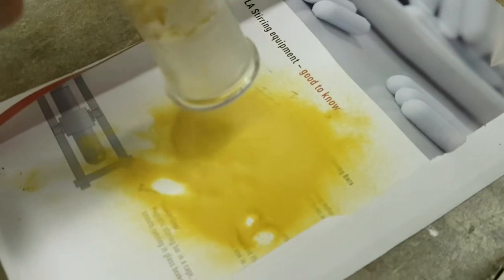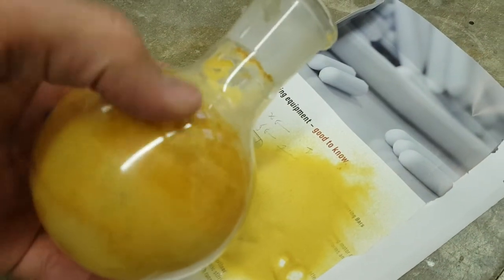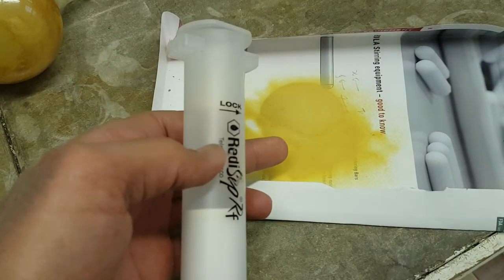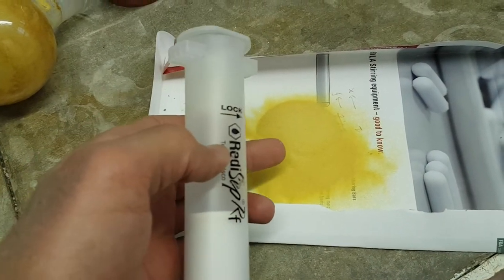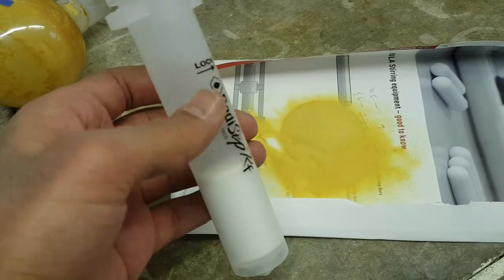So you pour your sample here and you scratch your bottle as well. You need to scratch your round flask from your sample, and then you move your sample, your dried material, to the cartridge here.